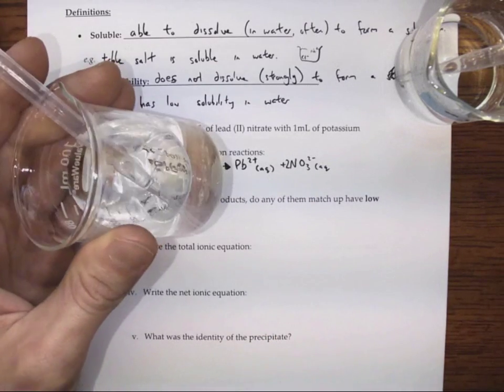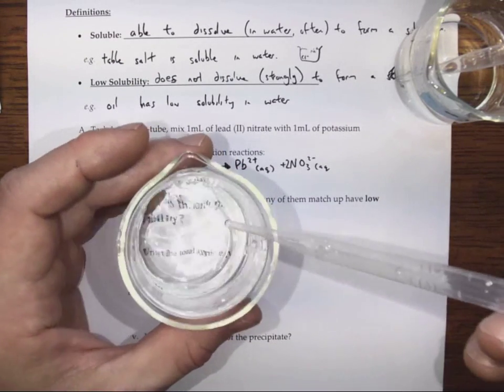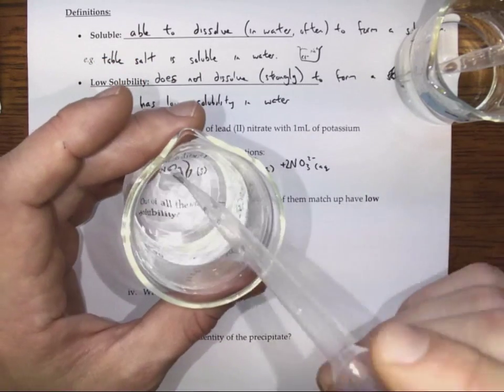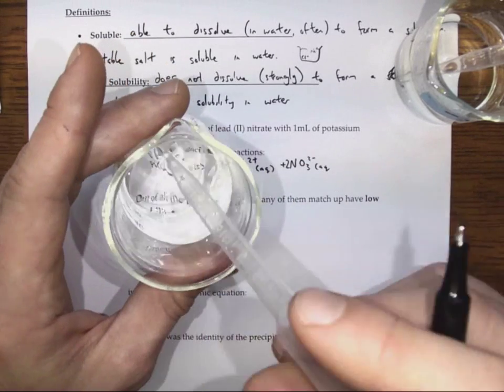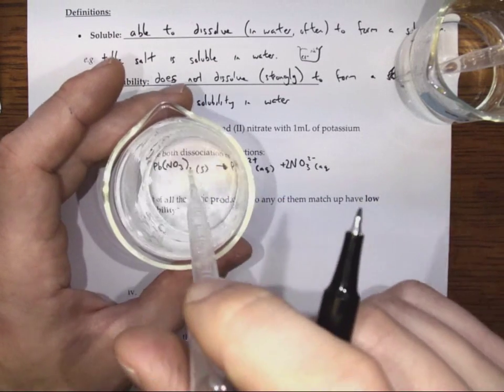So we can see here that we can't really see the lead or the nitrate. None of them refract or reflect light or absorb light significantly, so as a result, it looks just like a clear substance. And that's typical of solutions. Not necessarily that they're always colorless, but that a solution typically is clear. You can usually read through it, even if there's a color.